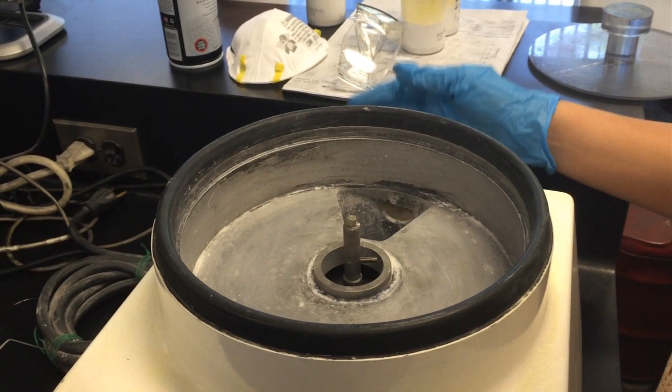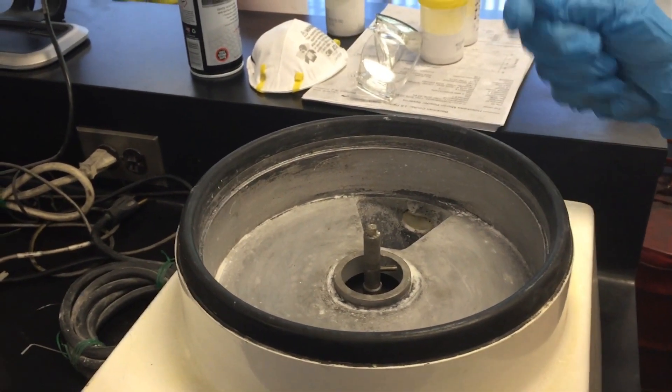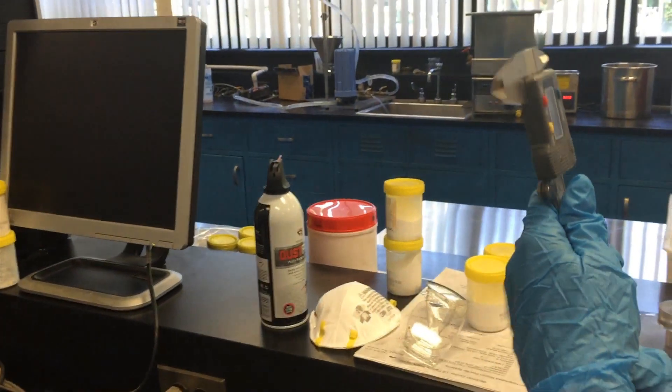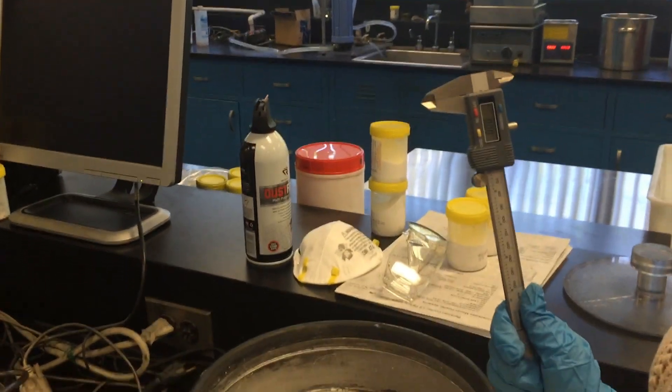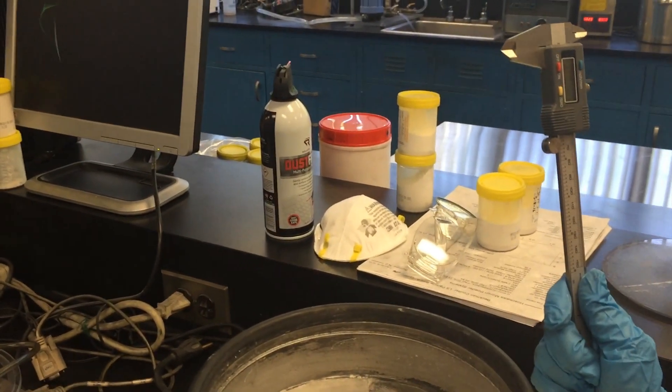There's two ways to double checking the height of the nylon screw, and one way is by using a caliper. You want to make sure that the height of the nylon screw is 5mm above the shaft's end, plus or minus 10%.